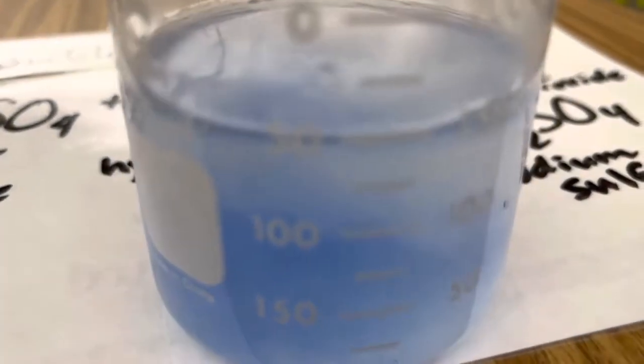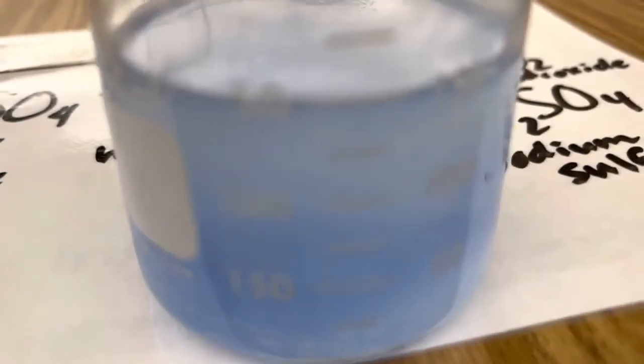There it is. Just amazing. You can see that precipitant start to form at the bottom.